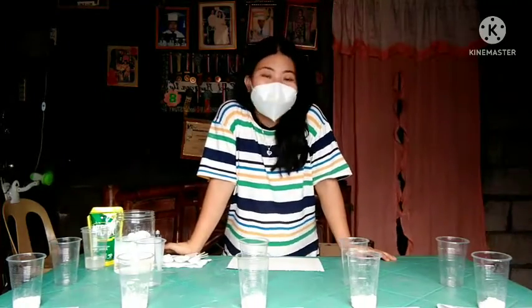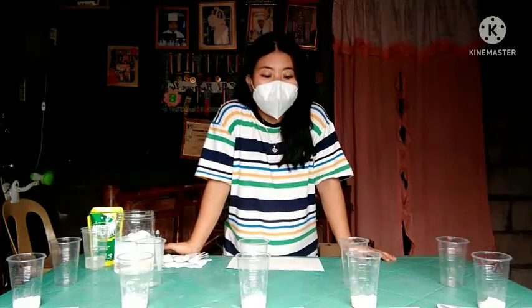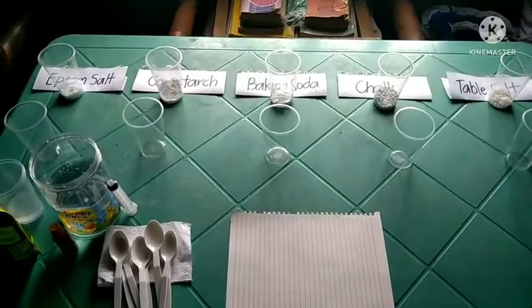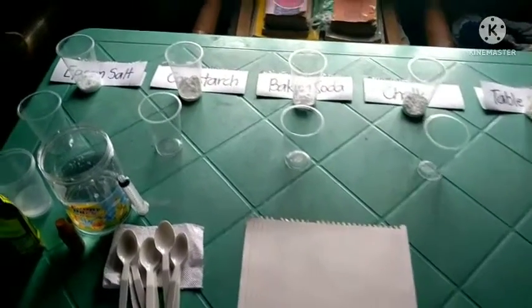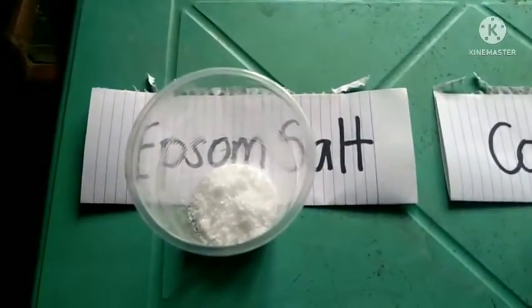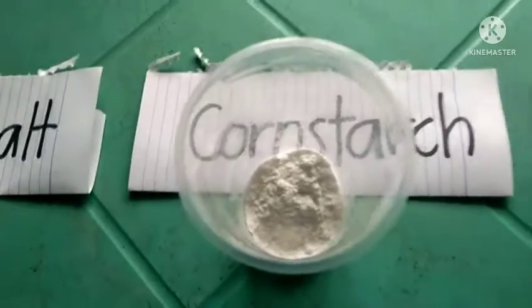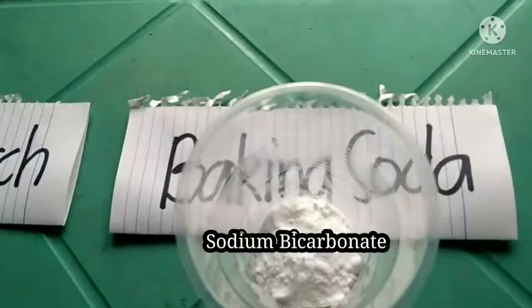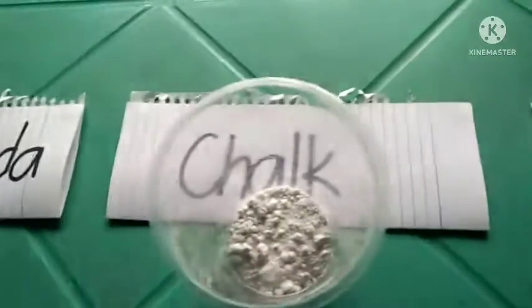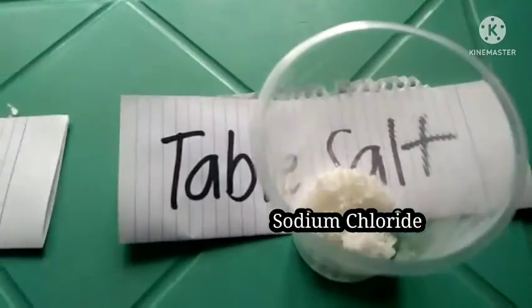So, tara, samahan niyo akong ipakilala ang mga materials to be needed in this experiment and especially those chemicals. Let's go! So guys, these are the materials and the chemicals that we'll be needing in our experiment. The first chemical is the Epsom salt or the magnesium sulfate heptahydrate, cornstarch or the polymer of glucose, baking soda or the sodium bicarbonate, chalk or the calcium carbonate, and table salt or the sodium chloride.